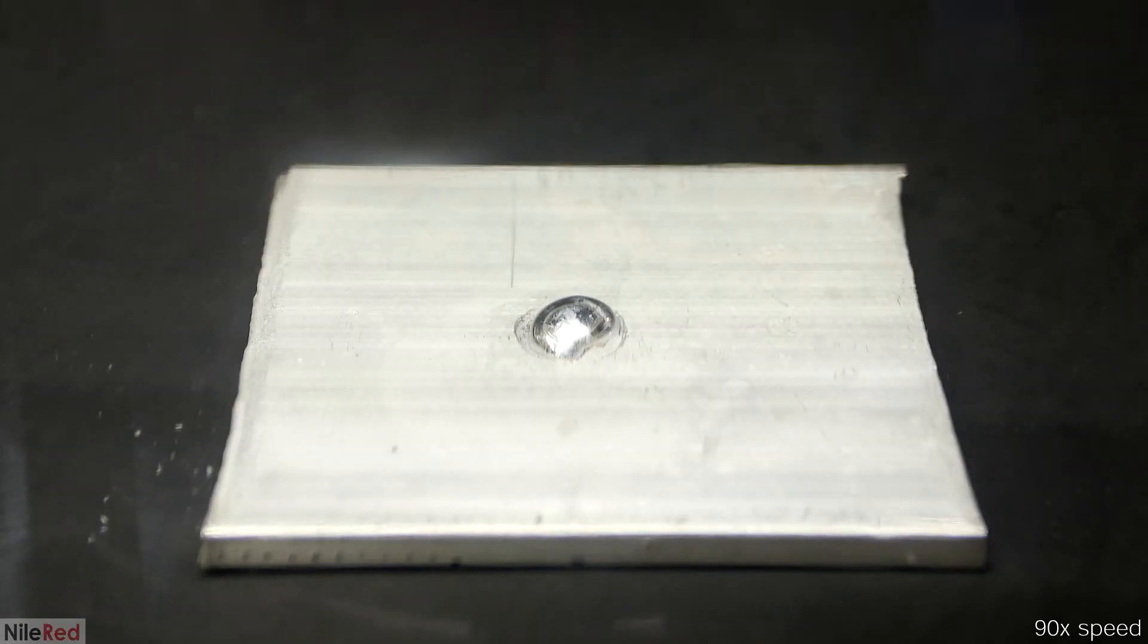One thing to remember though is that this reaction is really slow, and everything you see here has been sped up by about 90 times.